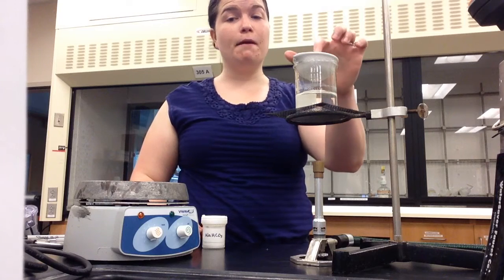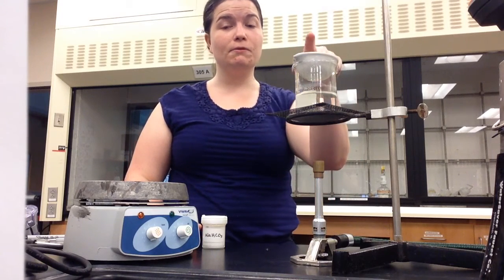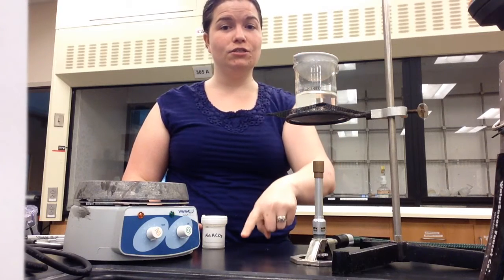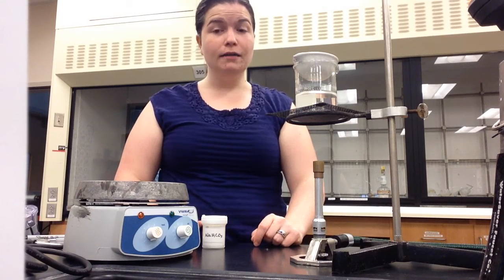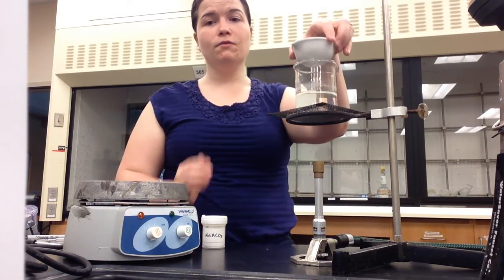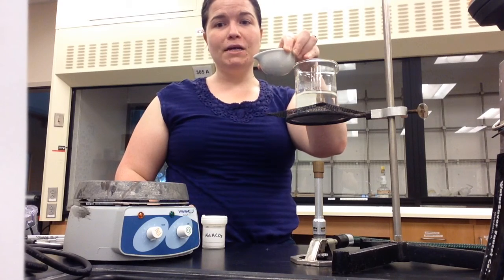The contents of the evaporating dish should boil gently, and overheating will result in the sodium chloride bubbling out of the evaporating dish and affecting your final results. After the sodium chloride in the evaporating dish appears dry, cool it, dry the bottom with a paper towel to remove any excess water, and measure the mass.